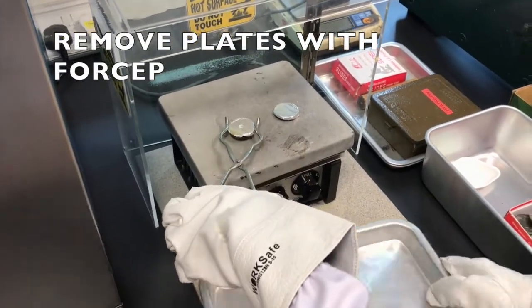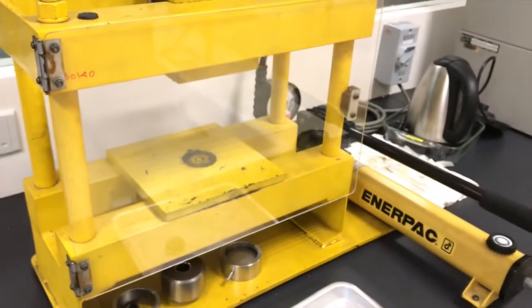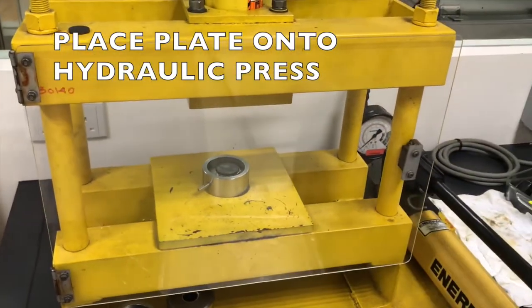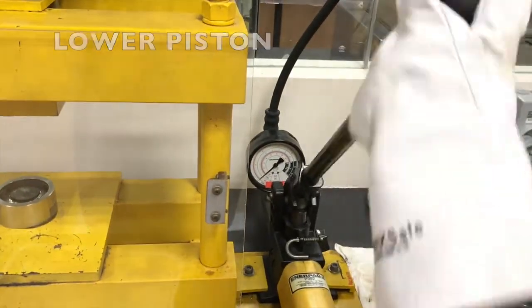Once the resin melts, sandwich both the cover plates together and transfer to the hydraulic press as quickly as possible. Once the film cools down, it will be difficult to remove it from the aluminium foil, which will be shown later. It's important to do things precisely and quickly to get a good film produced.